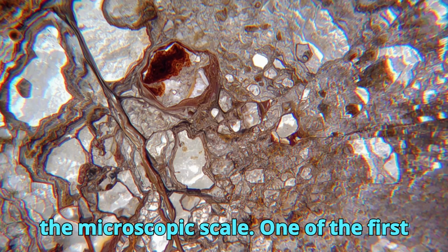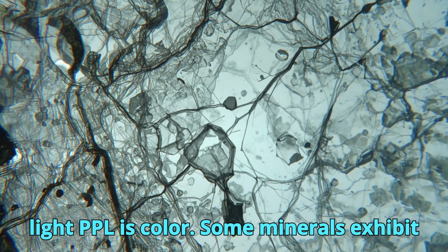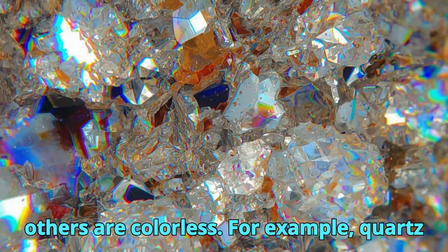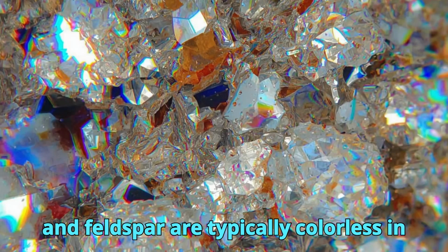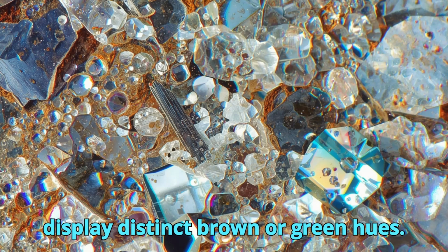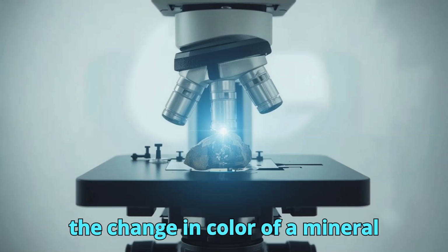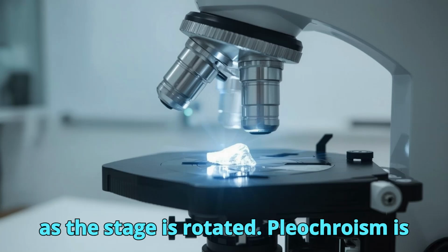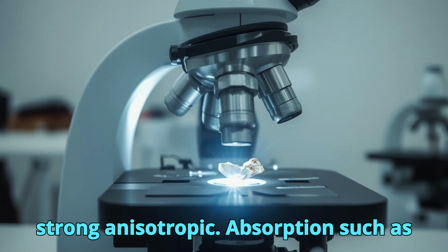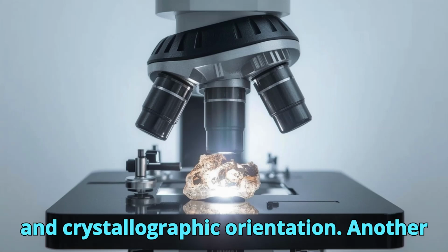One of the first properties observed under plane polarized light, PPL, is color. Some minerals exhibit characteristic body colors caused by selective absorption of light, while others are colorless. For example, quartz and feldspar are typically colorless in PPL, whereas biotite and hornblende display distinct brown or green hues. Closely related to color is pleochroism, the change in color of a mineral as the stage is rotated. Pleochroism is especially diagnostic in minerals with strong anisotropic absorption, such as amphiboles and micas, and provides immediate clues about mineral identity and crystallographic orientation.